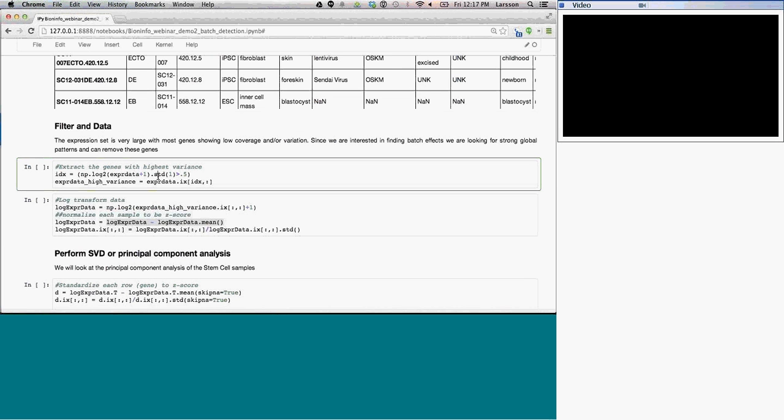But what I want to do first is the data set, the actual data that we download. The expression data is very large. It's 57,000 different locations, expression for 57,000 locations. Most of this data doesn't have very much variation, is not interesting, and to make the computations easier, I'm going to throw out all of the probes, all of the genes basically, that don't have variation across the standard data set, which means I log transform the data, and then I check for the standard deviation, and it has to be larger than 0.5. And then here I extract those. This is again just filtering down the data to a smaller size.